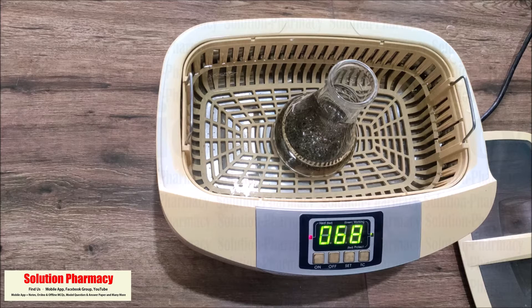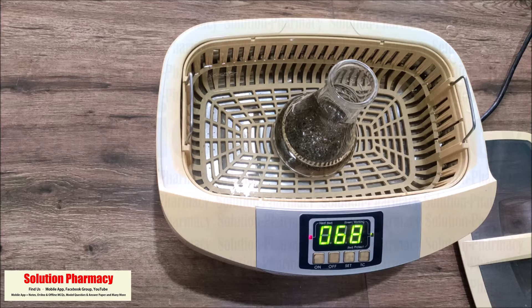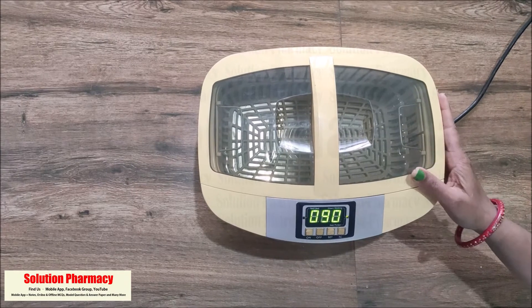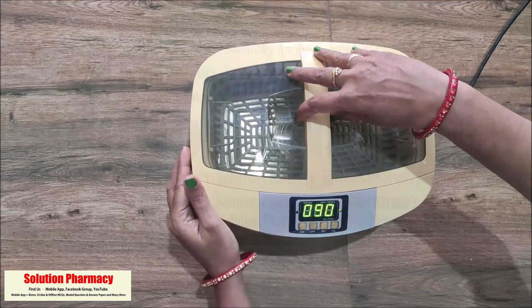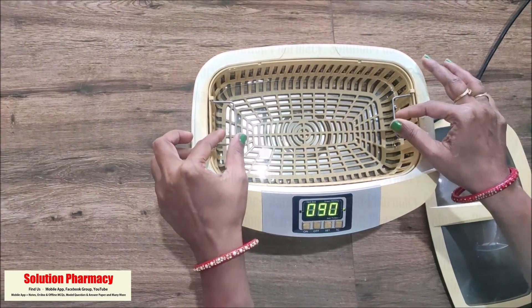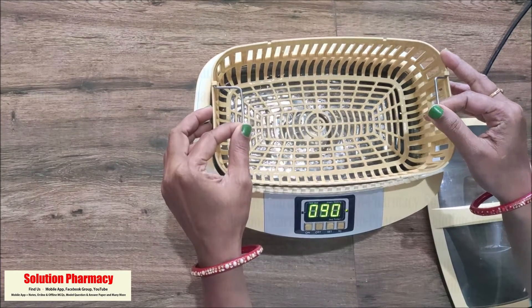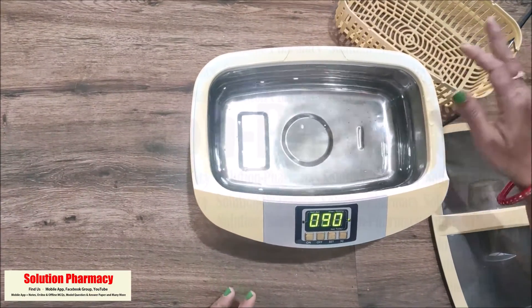In the bath type, the ultrasonic energy is not directly transmitted to the sample; instead, the ultrasonic energy is transmitted from the probe to the sample through the water present in the bath. This is the ultrasonic bath type sonicator. There is a lid provided on top, and with the help of the handle we can remove the lid from the bath. Inside the bath you can see a mesh basket, on which we place the container holding the sample powder for extraction. We can remove the basket using its handle.